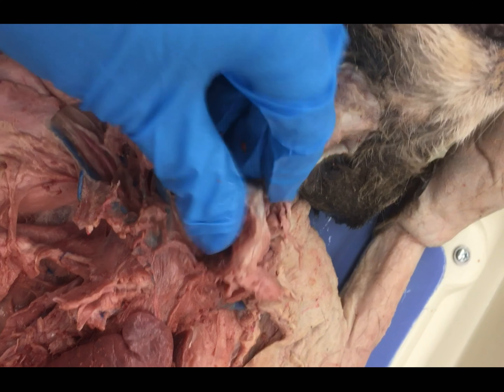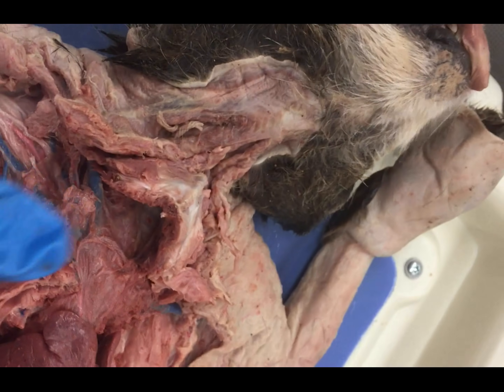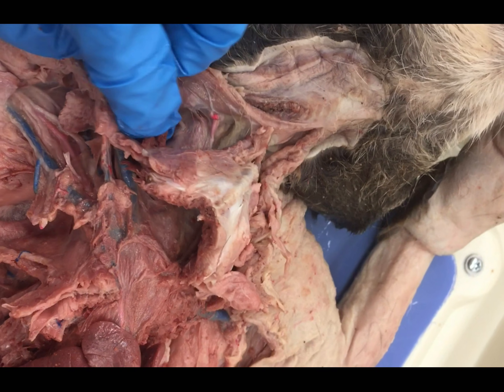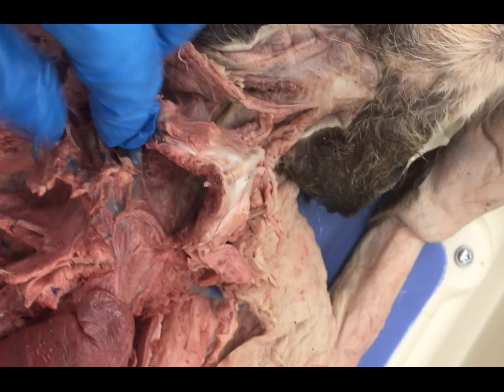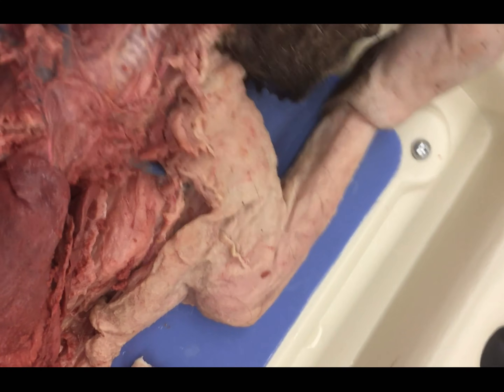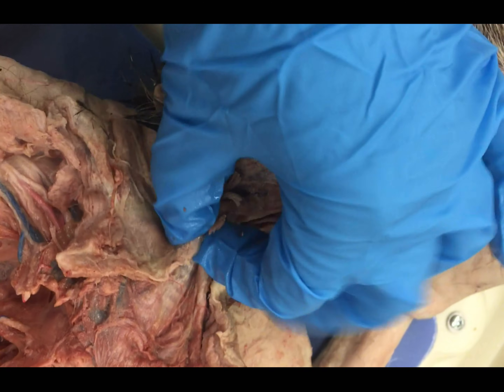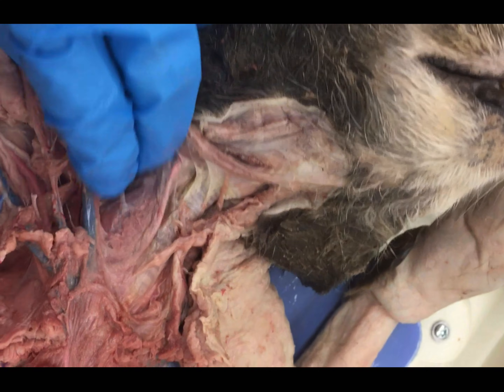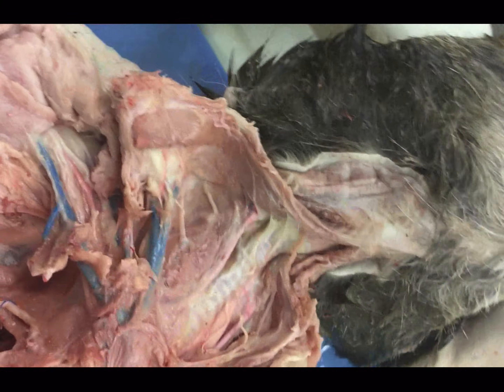You might just need to use your scissors at this point, being mindful of these deeper underlying vessels. The rule of thumb with cat blood vessels is if you nick it, it's okay — there's a second one on the other side. So if you manage to clip a jugular, it's okay. If you mess up a carotid, get it on the other side. So clip this guy off, remove it. And then what you'll have is the throat muscles here should be nice and closed up. If you take your scalpel and go down through here, reflect it back, you should start to see some of those vessels.